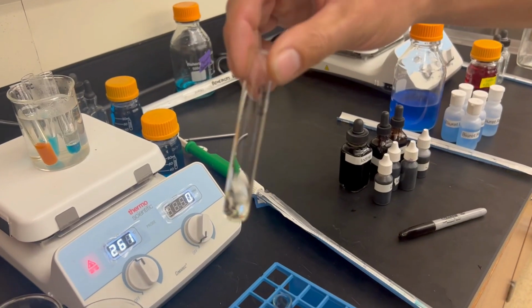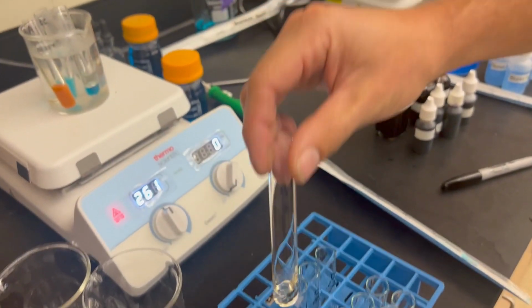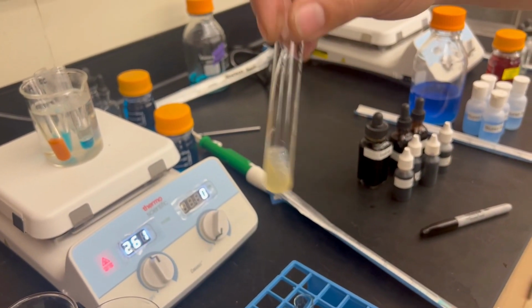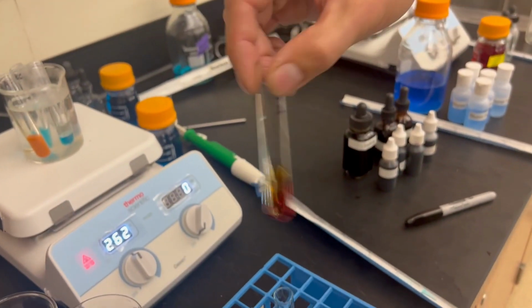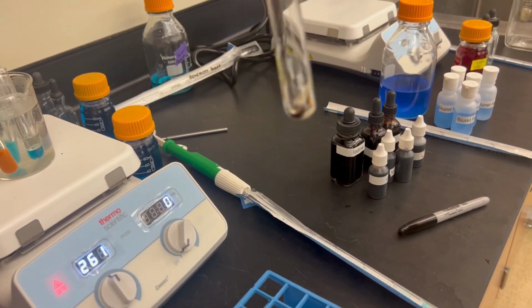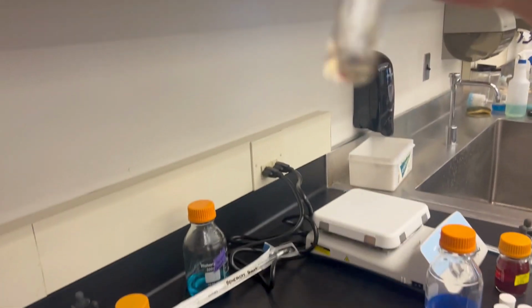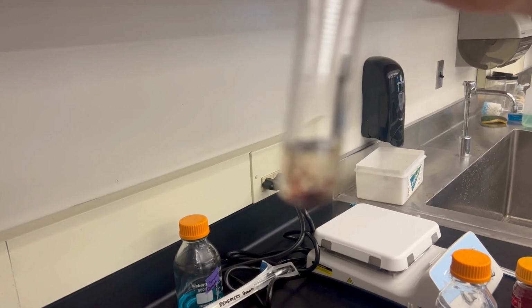After adding the iodine, we check to see for presence of color change. In A2 here, there was no color change up here. In B2, it does not appear there was a color change. In C2, we see there is a dark color change. In D2, the drop did not separate. Oh, really? Wait, let me see. Let me try and focus on it.